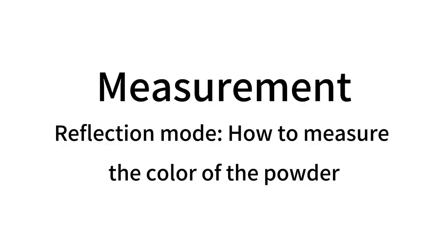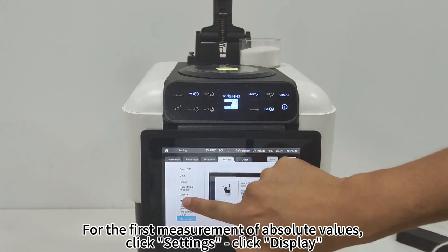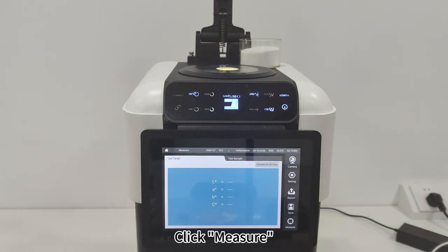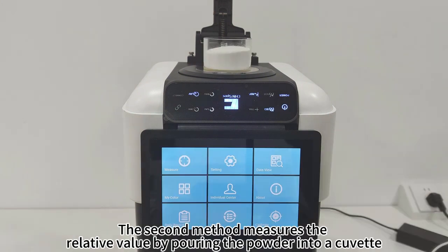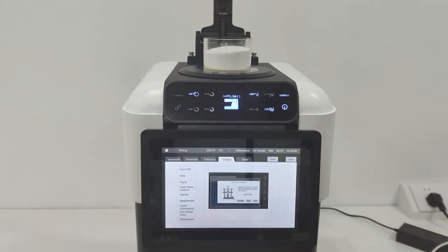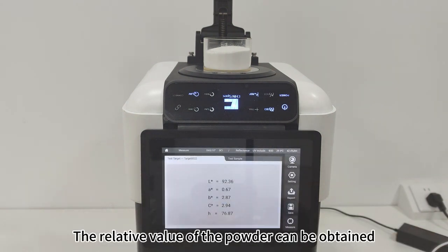Reflection Mode. How to measure the color of powder: There are two methods. For the first method measuring absolute values, click Settings, click Display, click on Titanium Dioxide, and click Apply. Click Measure. Press the powder into a compact form for measurement as prompted — this method can measure absolute values. The second method measures relative values by pouring the powder into a cuvette. Click Settings Display, click Color Diff Apply, then click Measure. The relative value of the powder can be obtained.